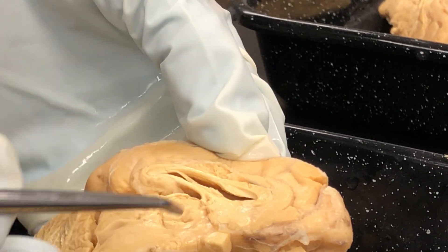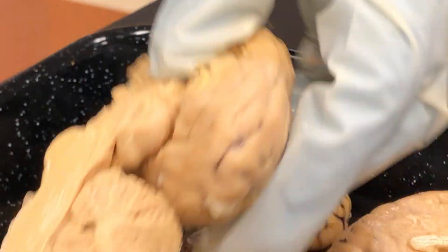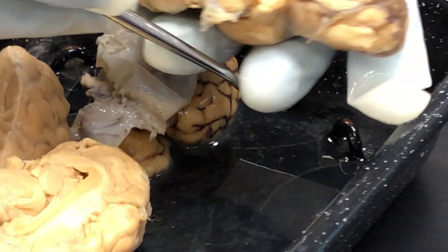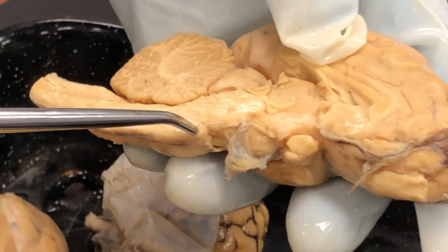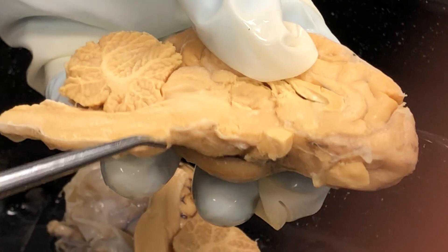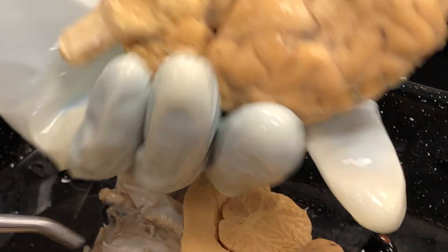We have already discussed the cerebellum and the arborvitae. The last structure on the mid-sagittal view is the pons — this little bulge right here. Let me find a better example of it. Here's a better example right here, and you can see it from the underside as well.